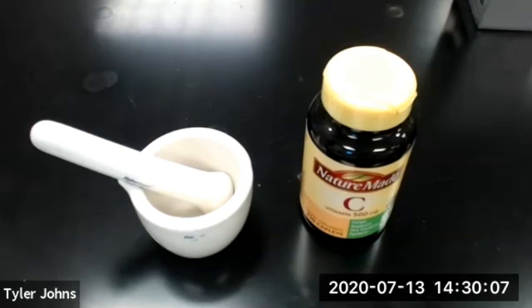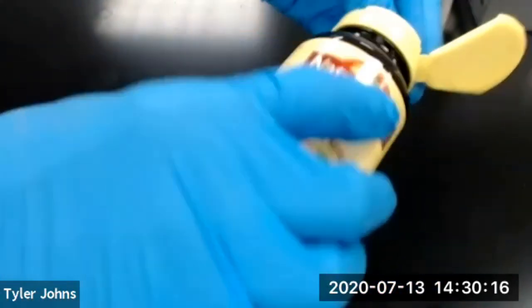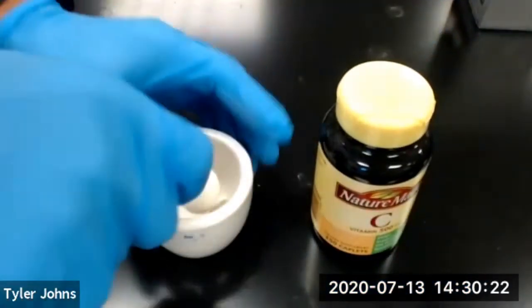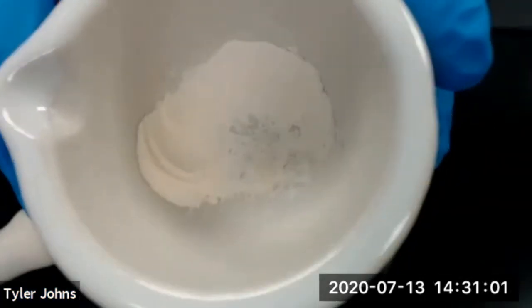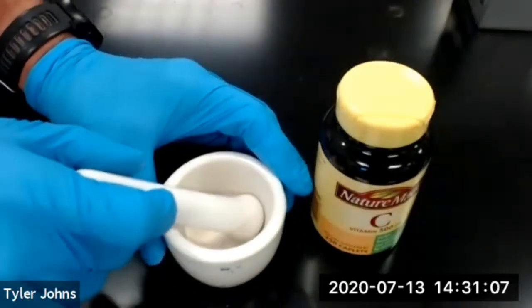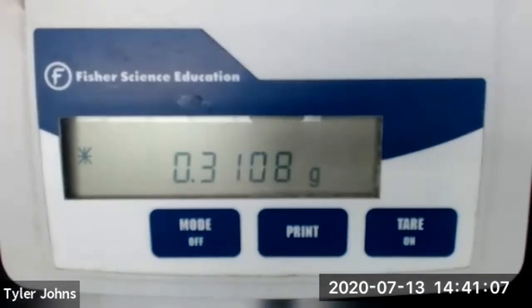We first need to prepare our vitamin C samples. We're going to be using these Nature Made vitamin C tablets, and we're going to remove one of the tablets and crush it using a mortar and pestle. After completely crushing our vitamin C tablet, we need to divide the tablet in half and record the mass of each half. The mass of the first half of the tablet that we will be using for trial number one is 0.3108 grams.